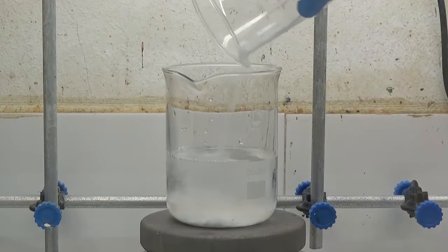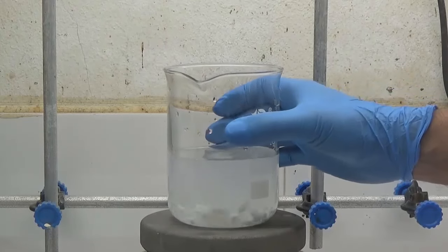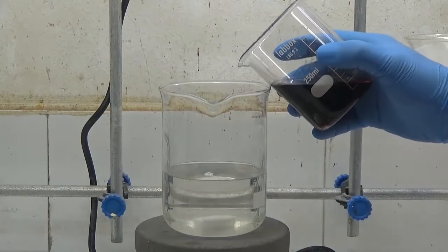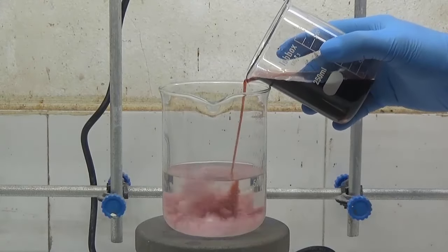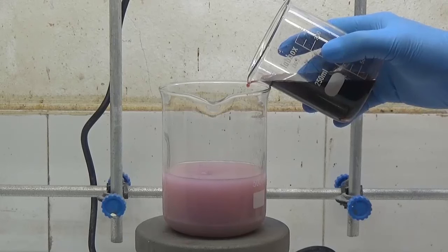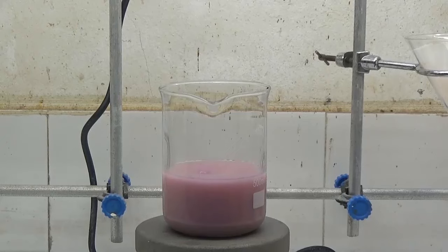Add 50 milliliters of water, then add a 0.1 molar solution of cobalt sulfate until barium sulfate does not precipitate. Verify with a small sample within a test tube.